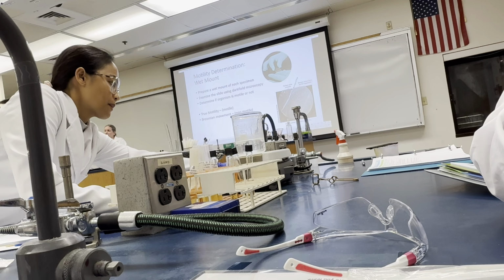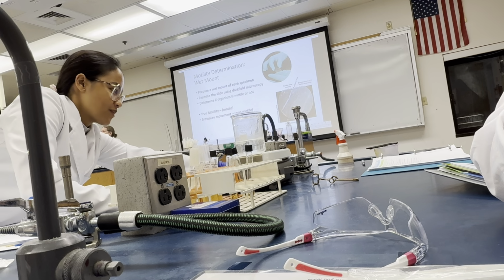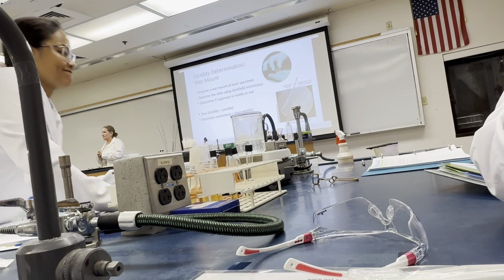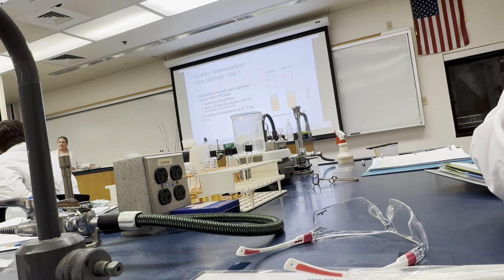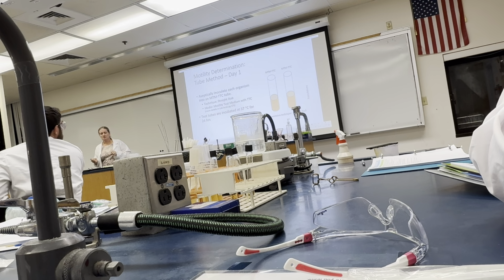What I will not do is tell you if your guess is correct. I'm not going to tell you whether you're right or wrong as to whether it is true motility or Brownian motion, because that's the whole point of the tube test. And you won't get the tube test results until Monday. I know, I'm going to have you get a cliffhanger until Monday.